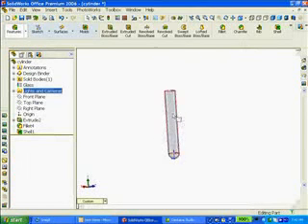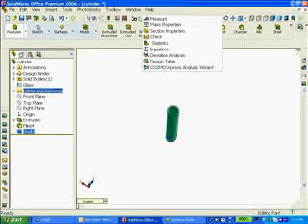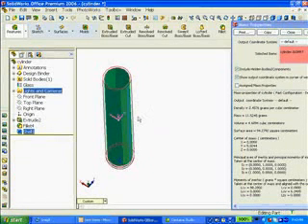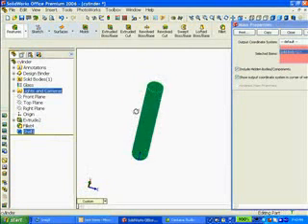Now, when I calculate the surface area of the outside of the glass or the inside of the glass, the geometry here becomes a little bit more complicated if I was going to use theoretical formulas. So, for this case, I will use Mass Properties. Mass Properties provides me the density of the glass, the mass of the glass tube, the volume, which is the amount of glass, not the volume inside the tube, and the surface area. The volume that you would require to measure the water inside the tube has to be modeled somewhat differently.